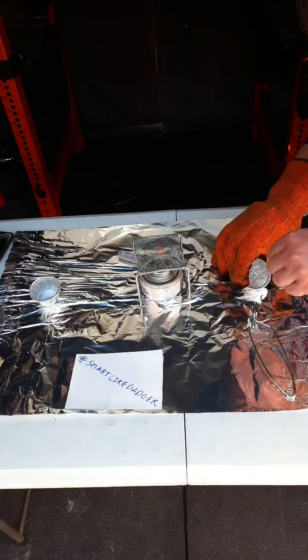Let's let this cool off a little bit. Very hot. Will melt a little bit on the table.